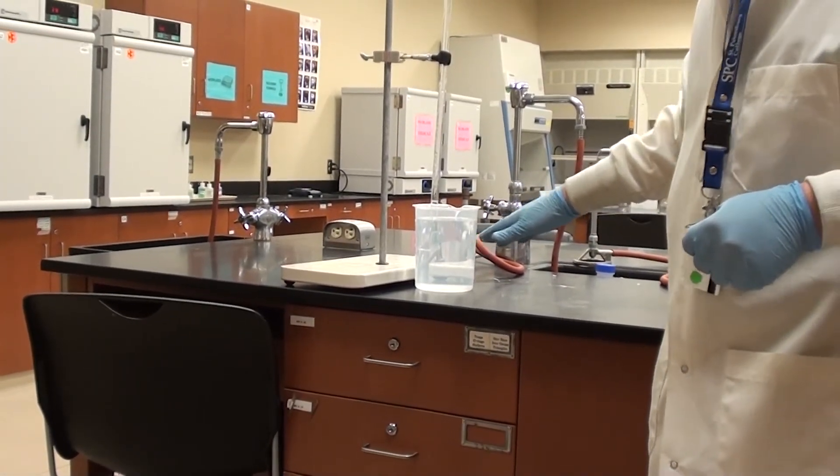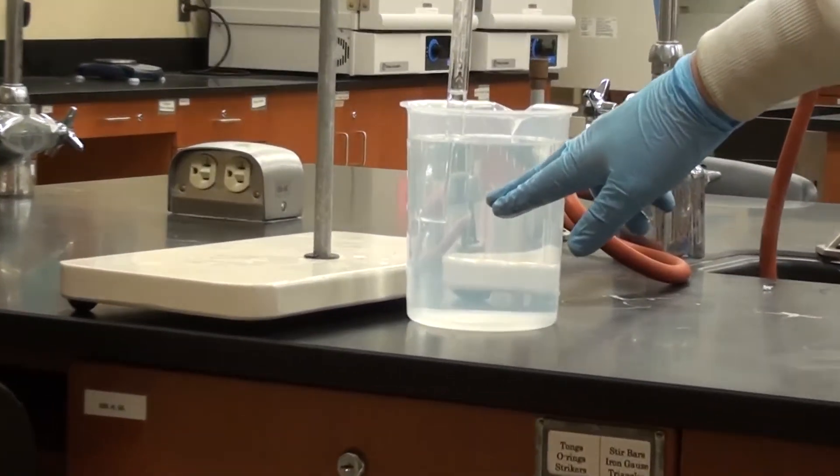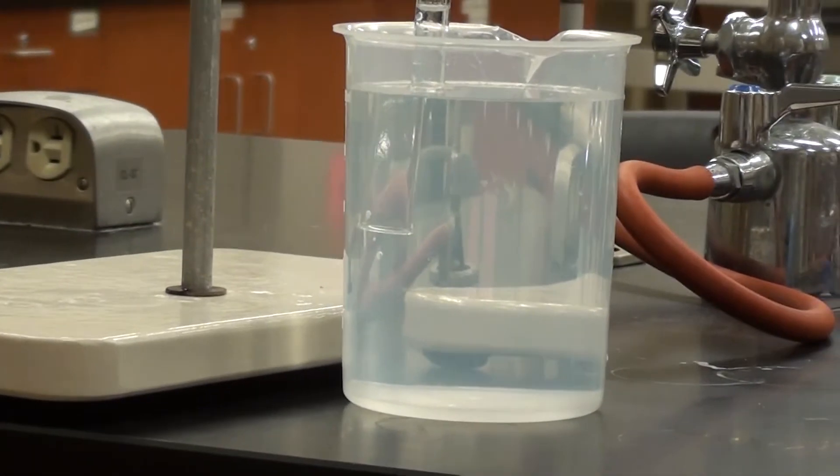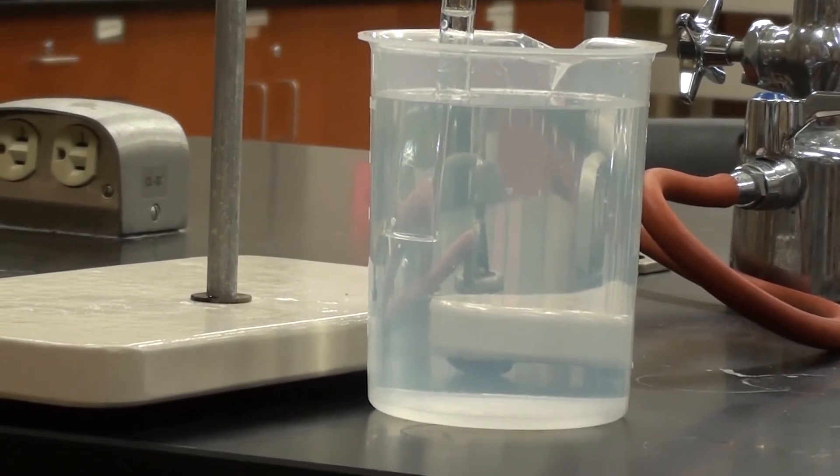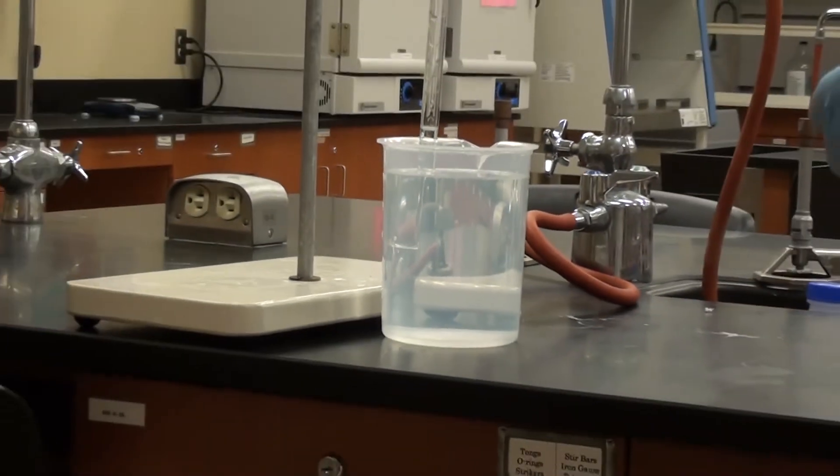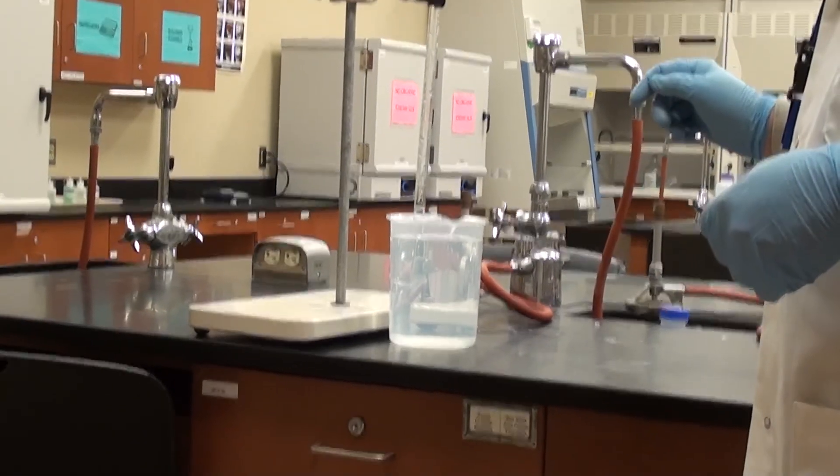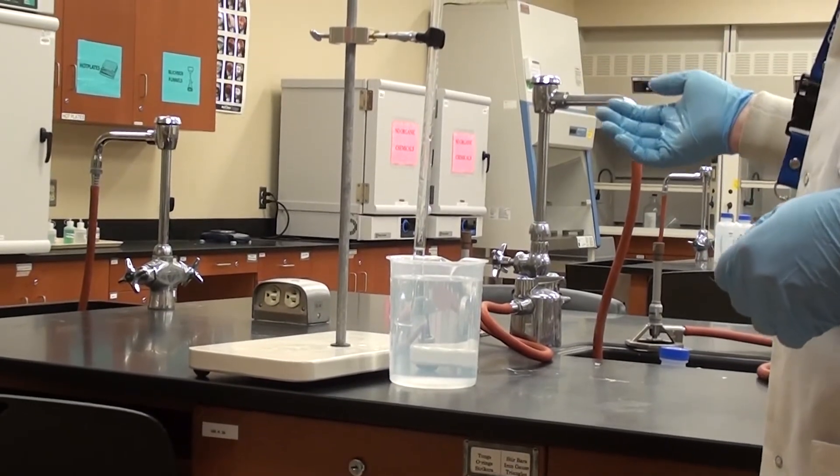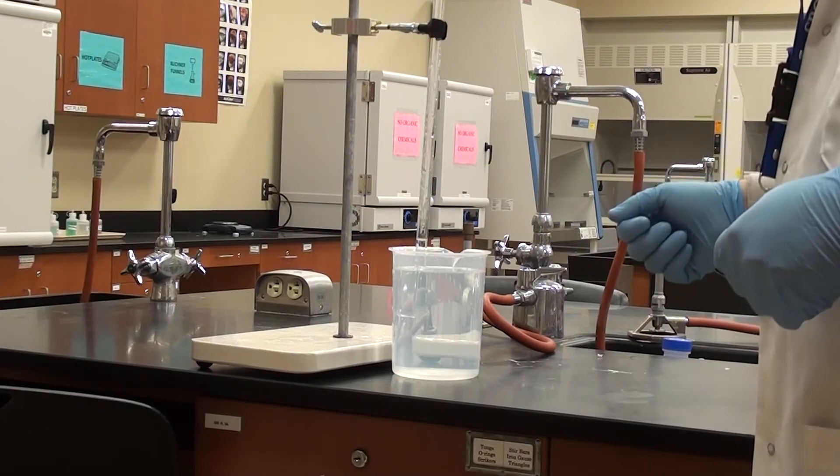Could you please zoom in on that? Now you can see that's underneath the level of the water. Now I'm looking at this and it looks to me like all of the magnesium has dissolved, which is good, that's what we wanted. The other thing that's important is now just to wait a little while for this reaction to cool. And then I can equalize the pressure.